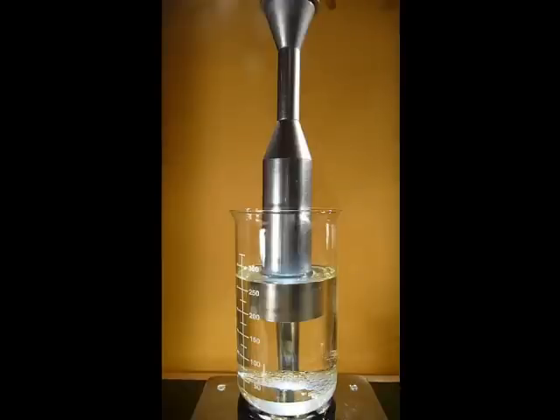The amount of liquid here is approximately five times greater than in the previous experiment, and we are going to keep the amplitude the same at approximately 60 microns peak to peak.